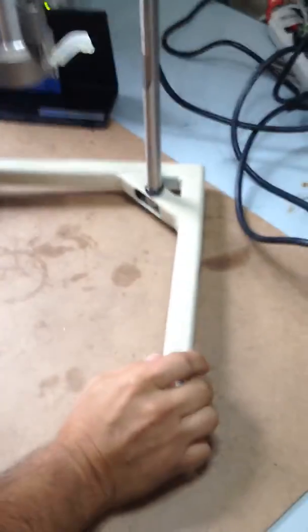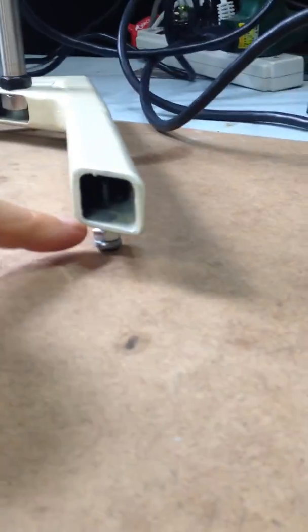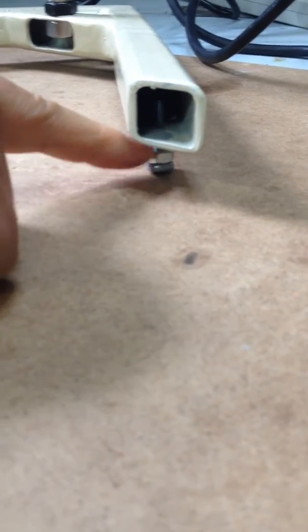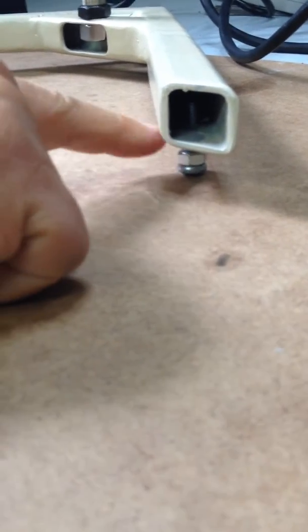You have to make sure that it's settled. One of the things is twisting like that from right to left. If it's off, you can adjust your stand. You got at the bottom here these screws that you can screw in or screw out for balancing the viscometer.